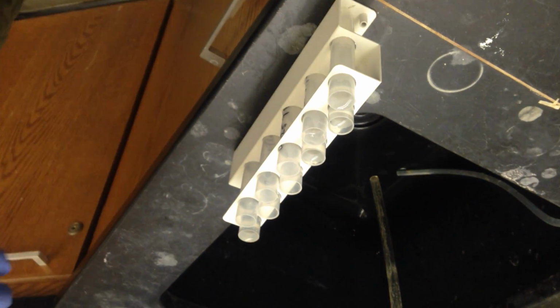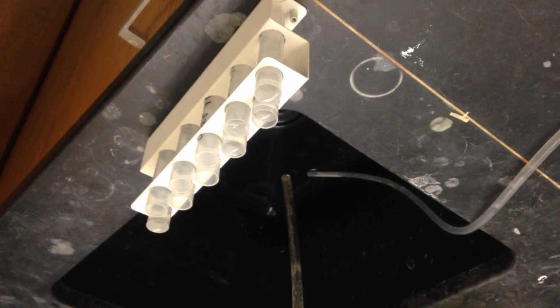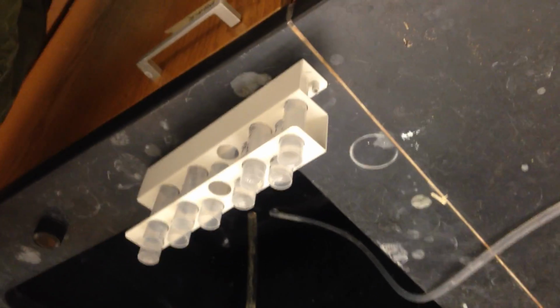And while you're doing this, you also want to keep an eye that you catch that spike when it comes through. Yes, if not, I'm going to miss the spike.